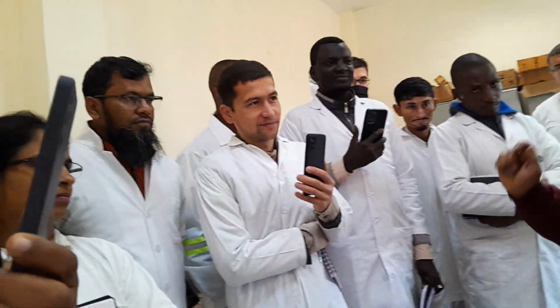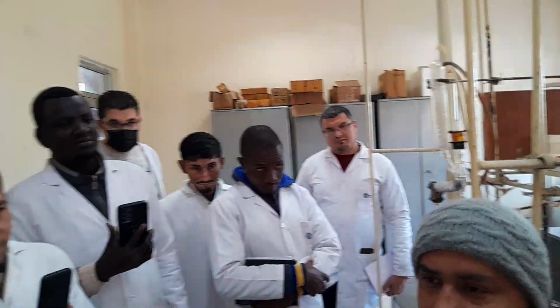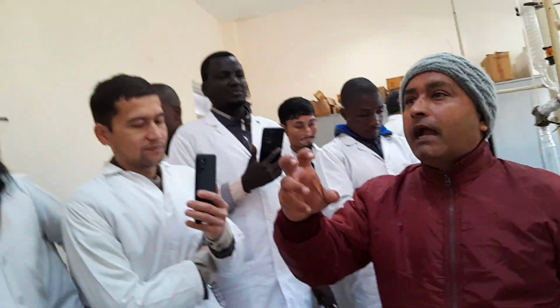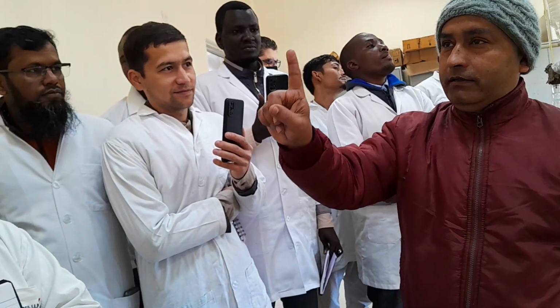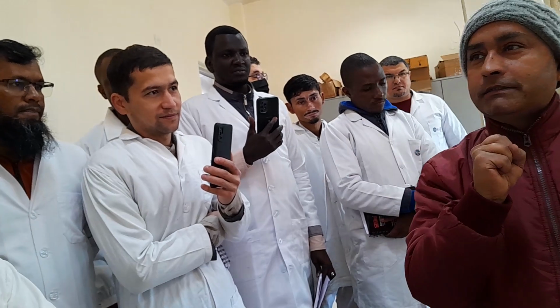So what will I do? I will make flooding inside the column. Flooding means that the maximum sample comes out at once. I will explain what the flooding point and the dry point are. When you try to make the flooding position, you get the product very fast, and you complete the distillation at 5:30, no problem, within 1 day. But where will you get caught?